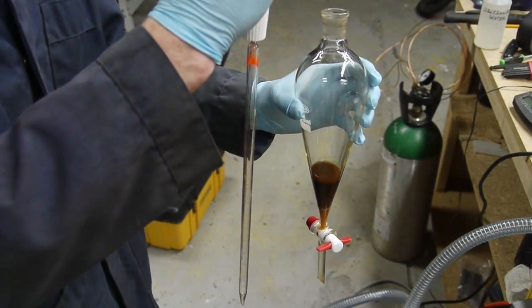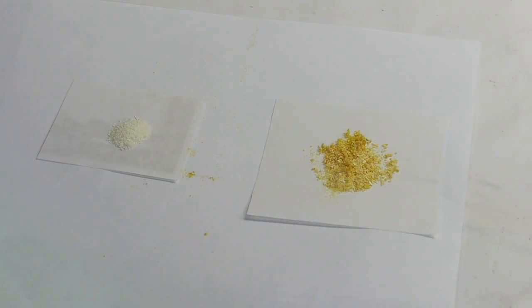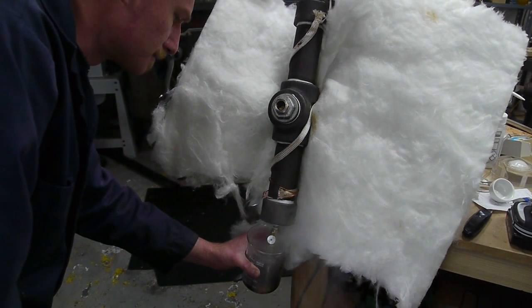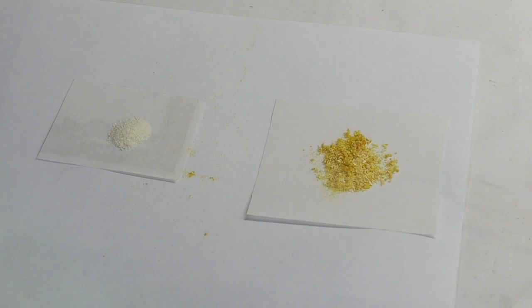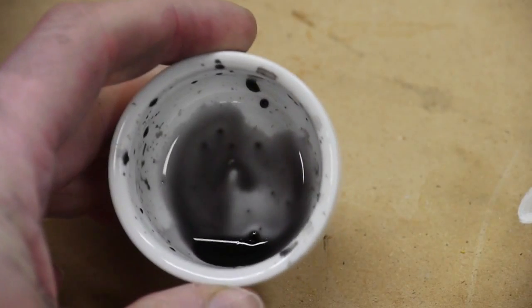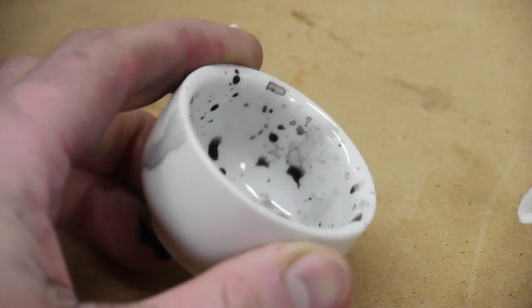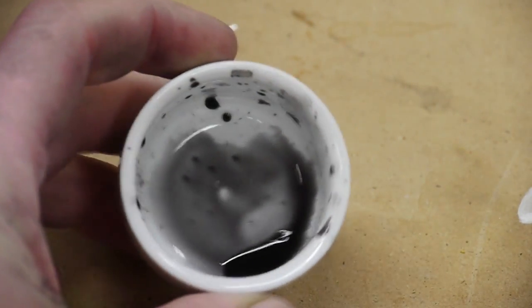I just love glassware. Hey everyone, in a previous video I showed the first half of this caffeine extraction experiment where I used supercritical carbon dioxide to extract caffeine from green coffee beans. At the end of the video, I said that I used methylene chloride to extract the caffeine from that caffeinated water that I pulled out of the supercritical chamber.